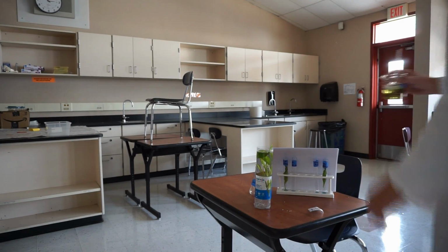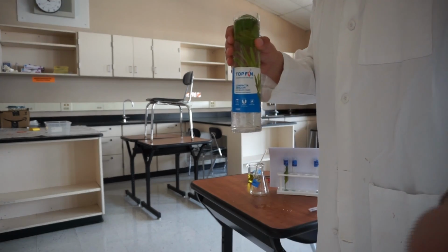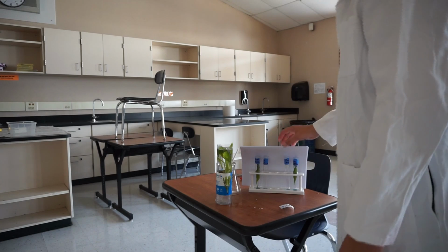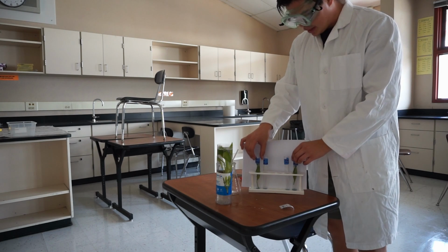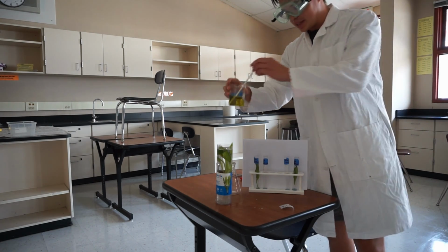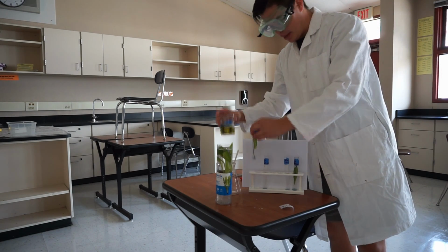Here we have a nice little plant, and I'm calling this plant Atlantis since it's an aquatic plant. Atlantis is going to help us because it's going to sacrifice a couple of its leaves for this experiment. I've already placed a couple of Atlantis' leaves in these test tubes. I'm going to put in this mixture of bromothymol blue with carbon dioxide, and I want you to predict what you think is going to happen when we put it in these test tubes.